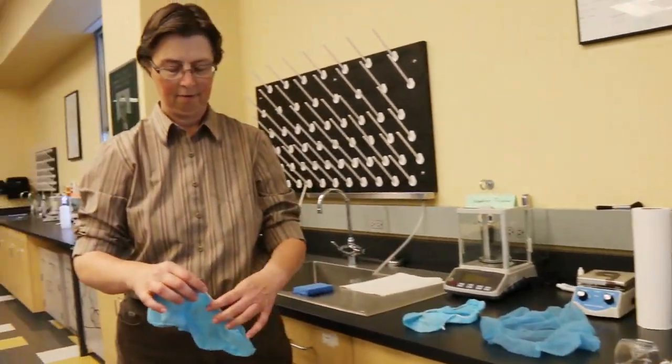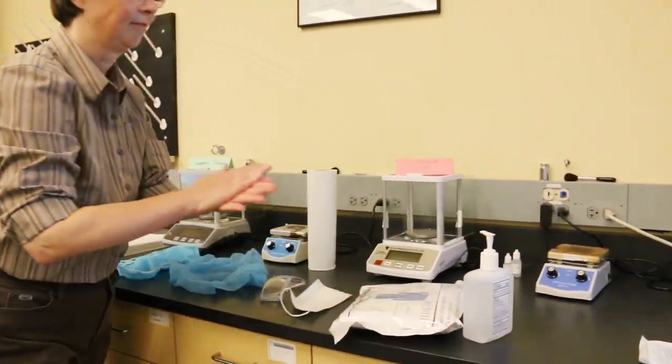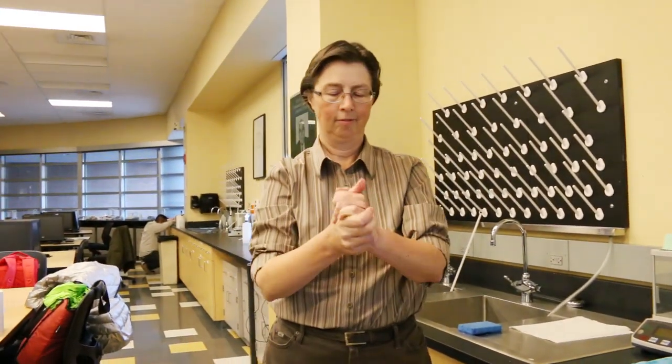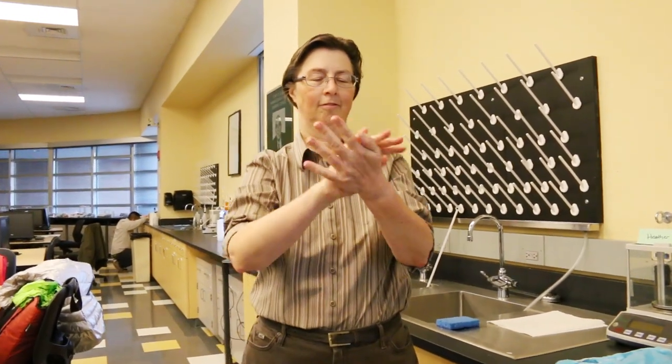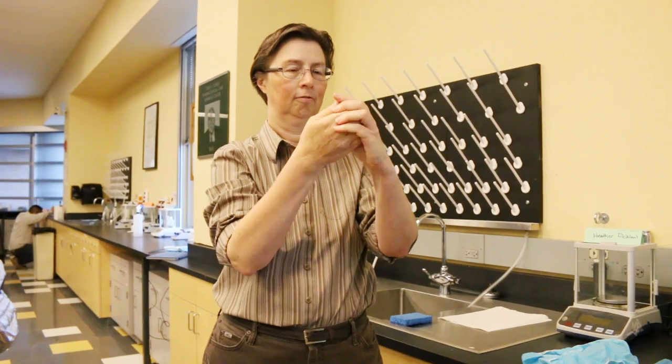Step 3 is to cleanse your hands with sterile, foamed, 70% isopropyl alcohol by holding the can so the tip is down into the palm of the opposite hand and coat your palms, back of hands and each finger and allow that to dry.